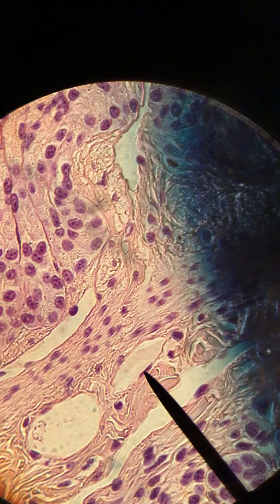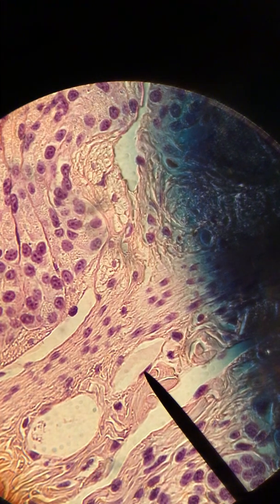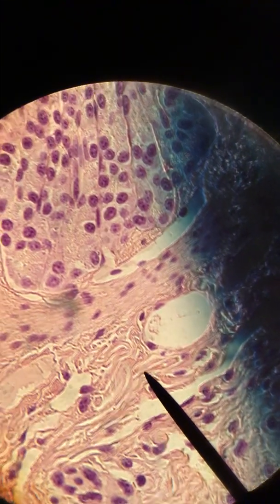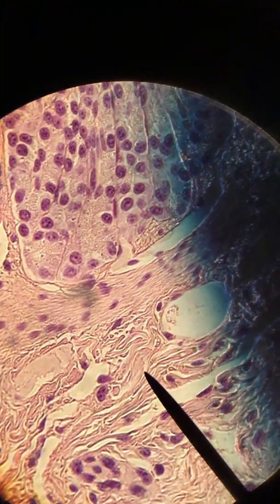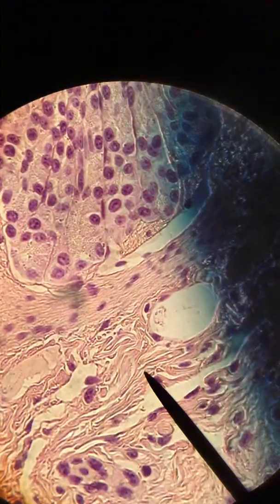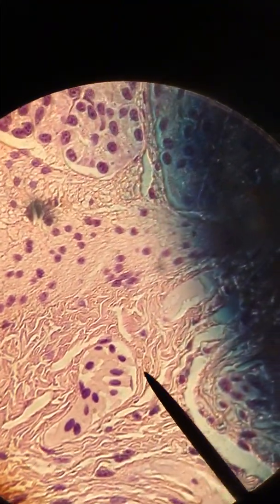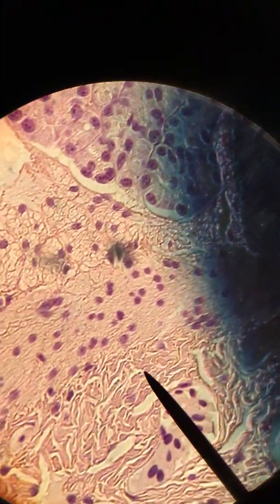We saw the goblet cells, and we're also supposed to look for irregular dense connective tissue. That will be just underneath and surrounding our blood vessels. Right in here, this is all irregular dense connective tissue, and here's more over here. You can see those fibers are randomly arranged, running every which way.